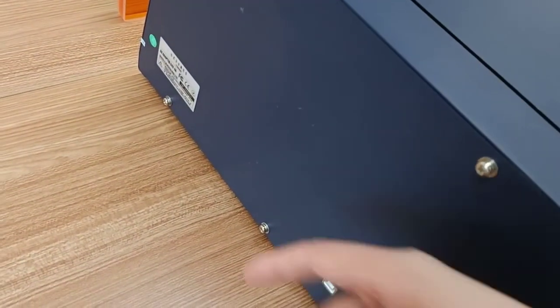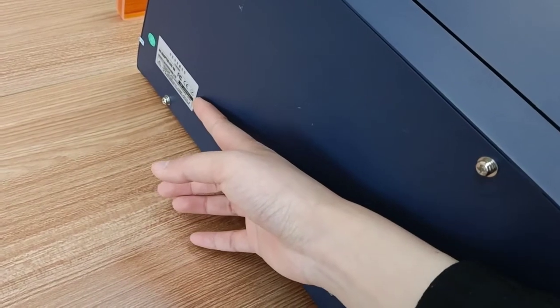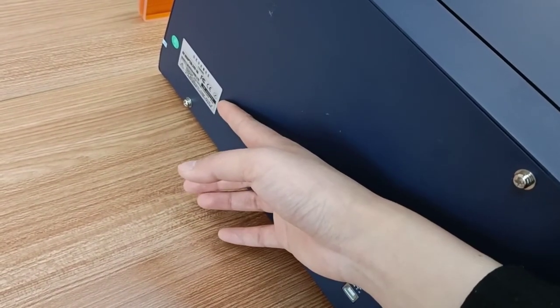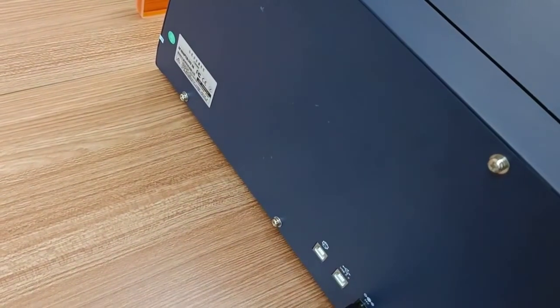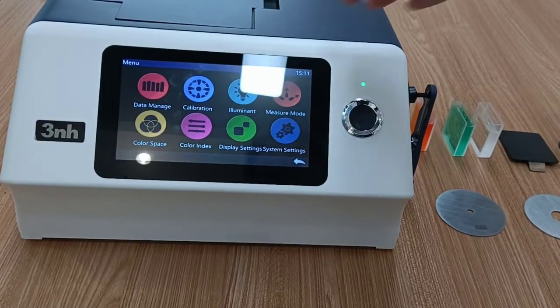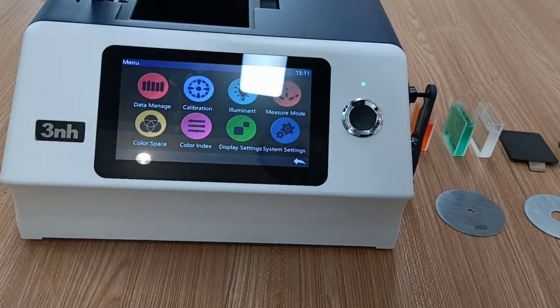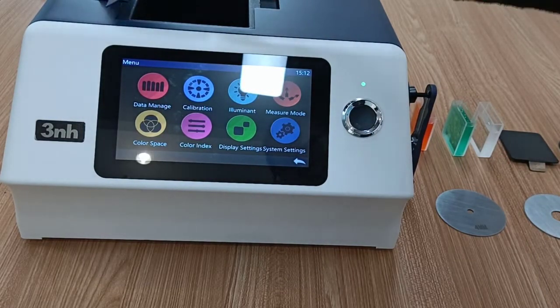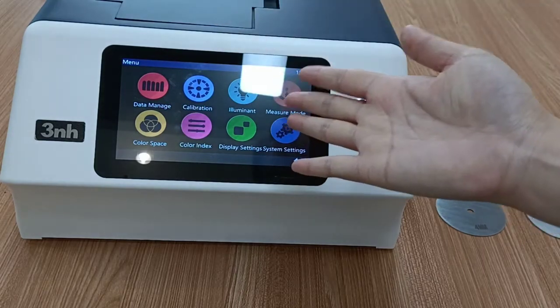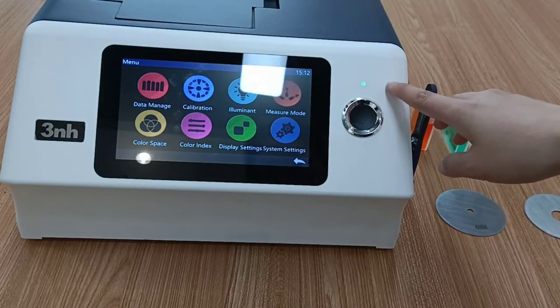At the left, we can see the model YS6060. And here is the transmissive measurement port, display screen, and indicator light.